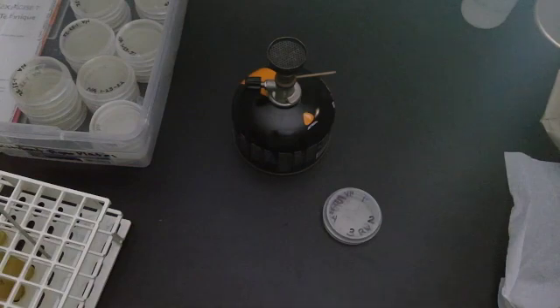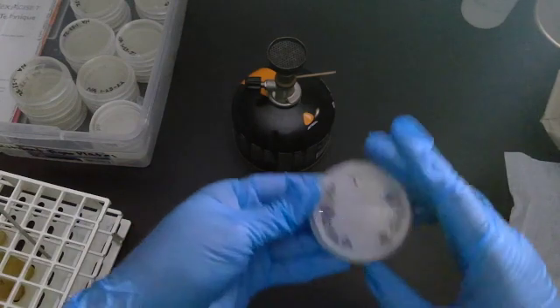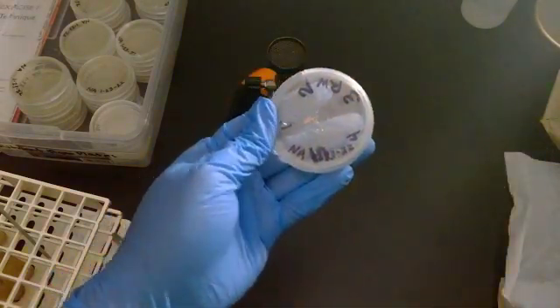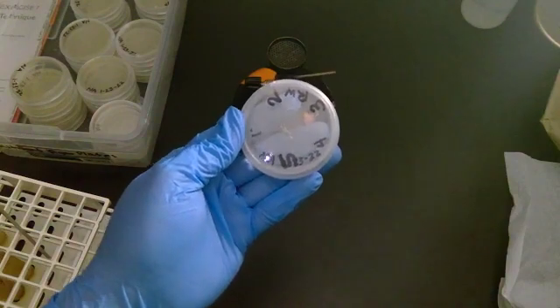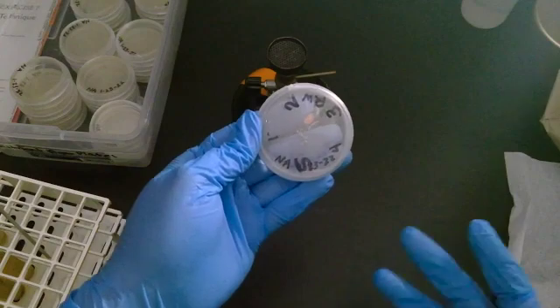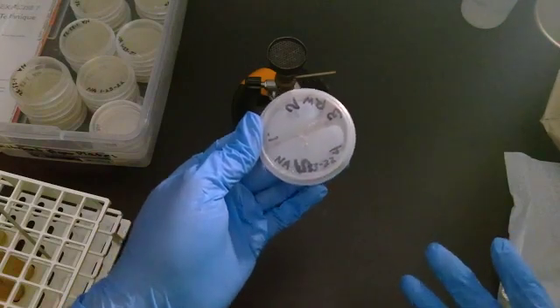Let it incubate for 24 to 48 hours, and hopefully in that path from number four to number five I will get some individual colonies. This takes time because it actually does require incubation.